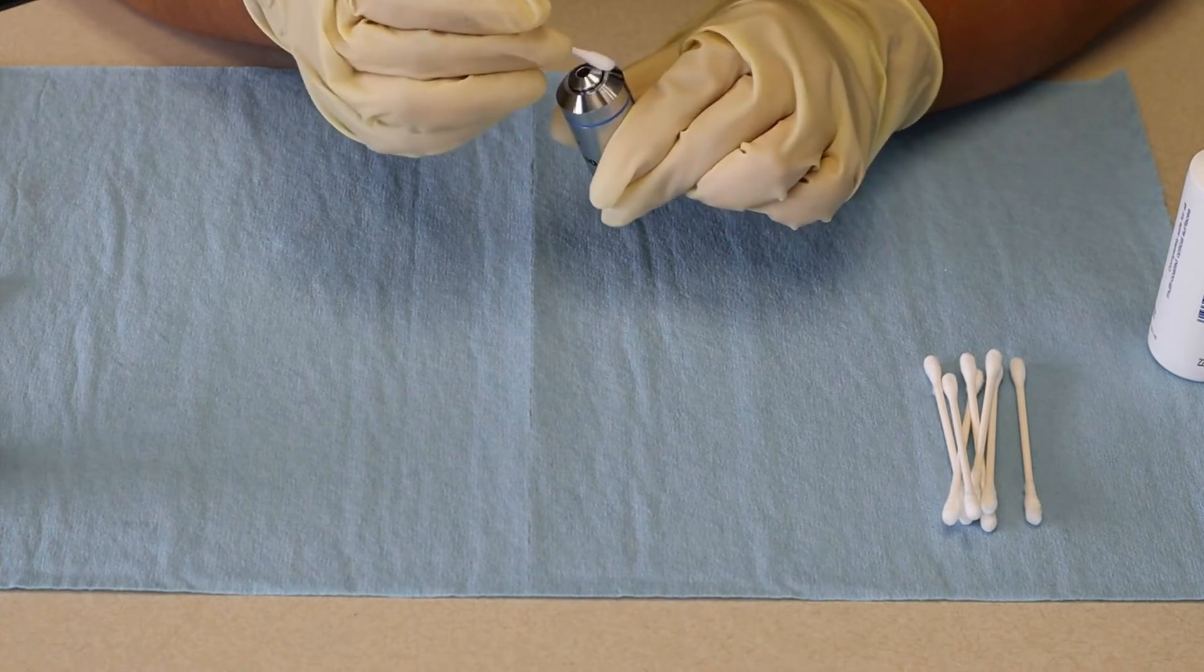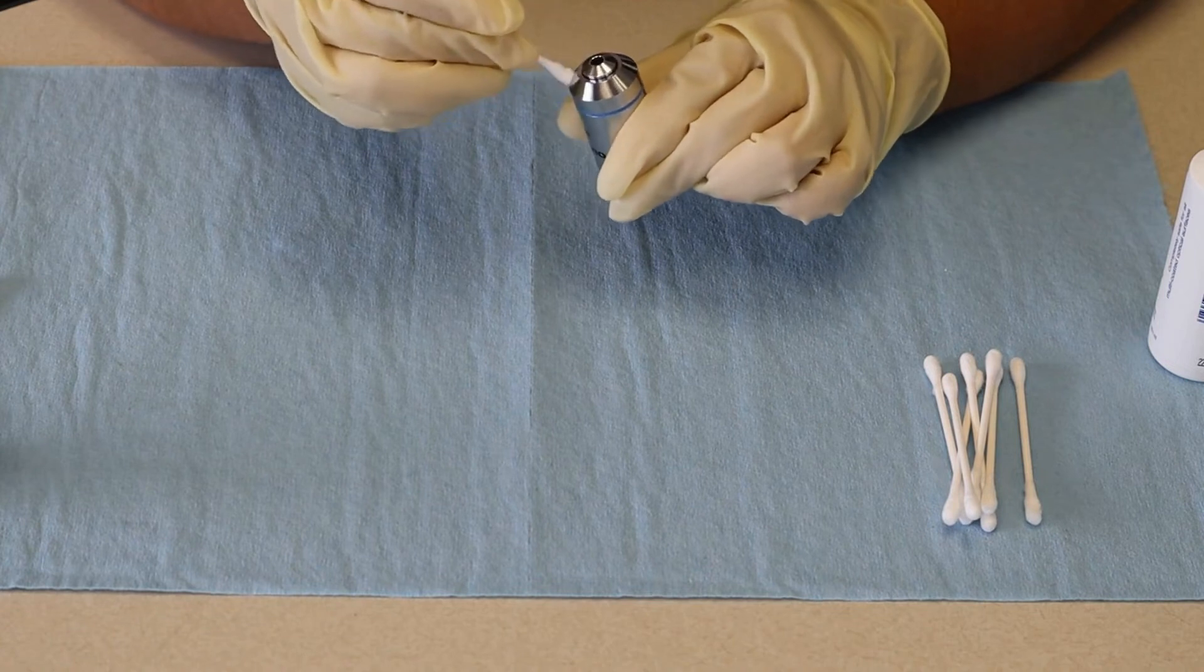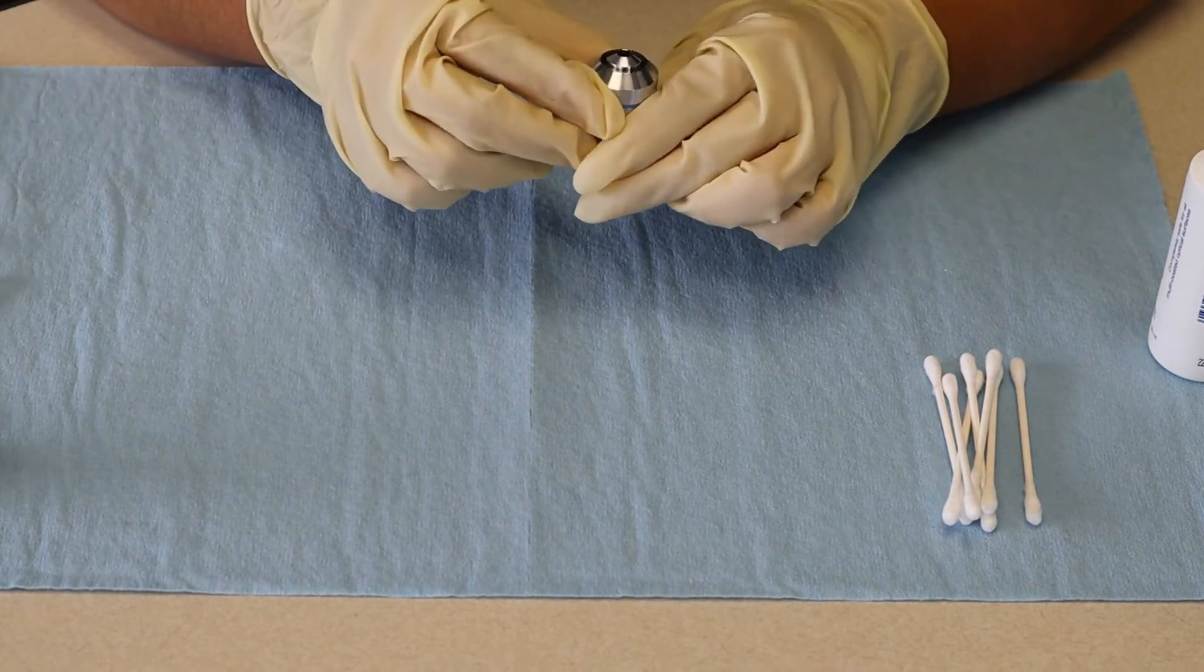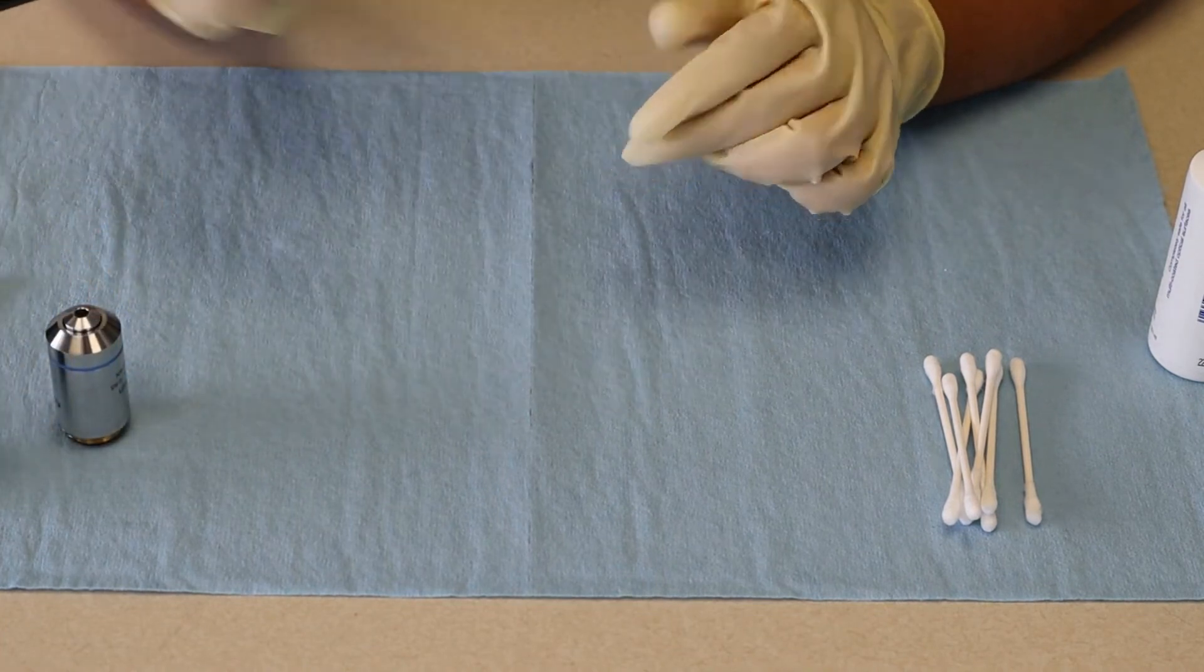Get the dry clean end of the q-tip. Okay, looks good. If you missed any spots, just get a fresh cotton swab and you'll be good to go.